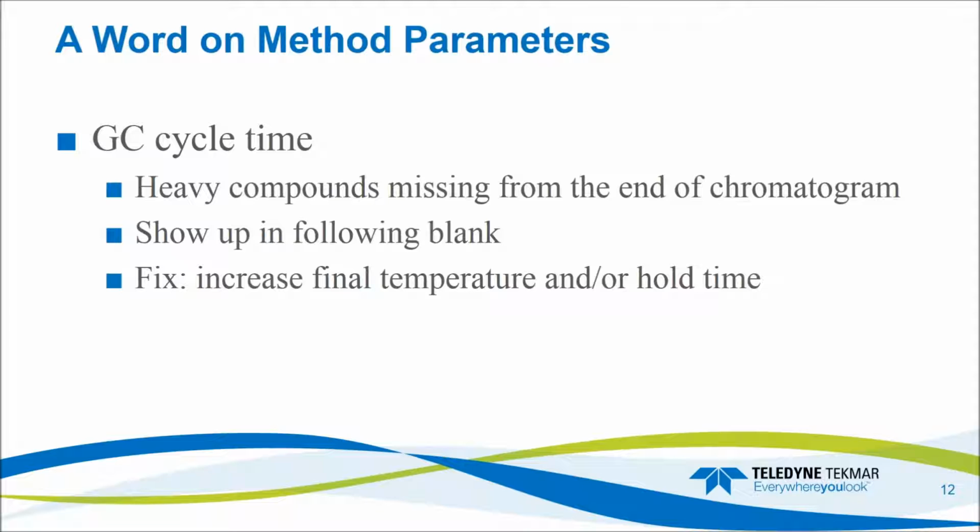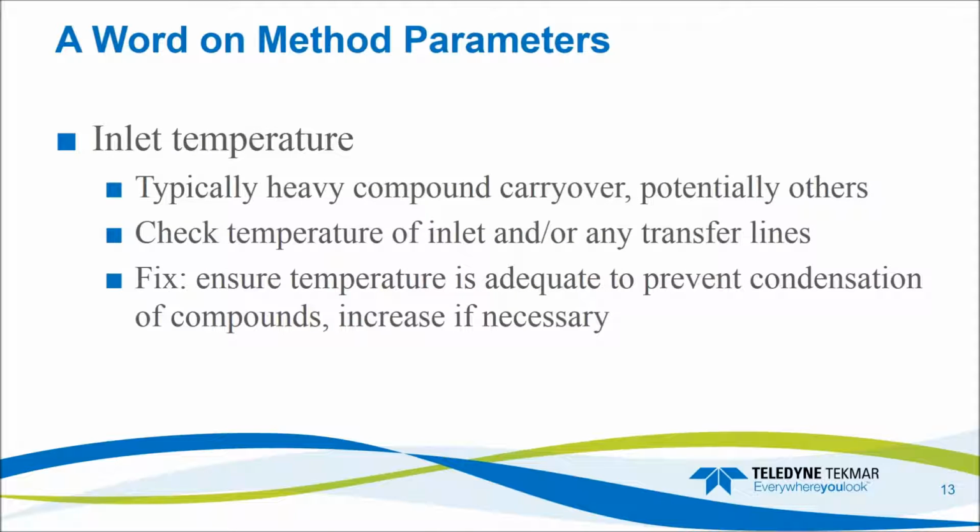And if all of the method parameters match up, then we know that we have some type of contamination in the system, and we can work to understand that. So a good example of method parameters, as I mentioned with GC cycle time: if you see your heavy compounds disappear off the end of your chromatogram, for instance, and then they show up in the following blank, what's likely happening is your column is not getting hot enough, or you're not maintaining that top temperature long enough to allow those compounds to sweep fully out of the trap and into the detector. So you'd want to increase your final temperature or your hold time to make sure all those compounds are swept through the detector before starting the next sample. Similarly, you could have compounds condensing in your inlet, and so if your inlet temperature isn't high enough, you might have things condensing out, and then you'll see some carryover or reduced sensitivity. And then the same holds true for any transfer lines from an autosampler to the GC.